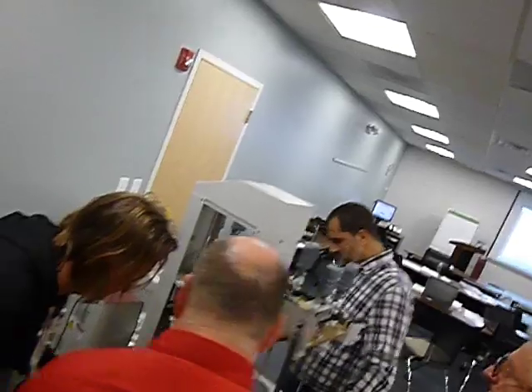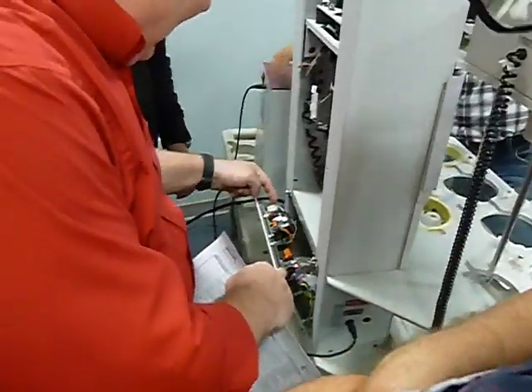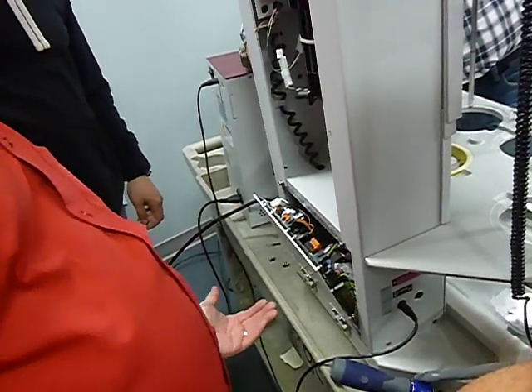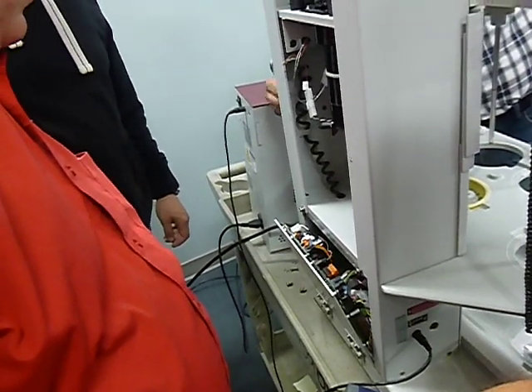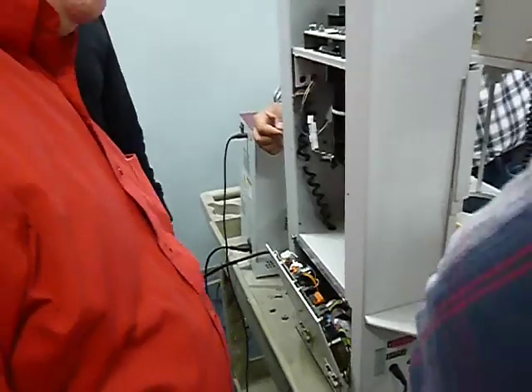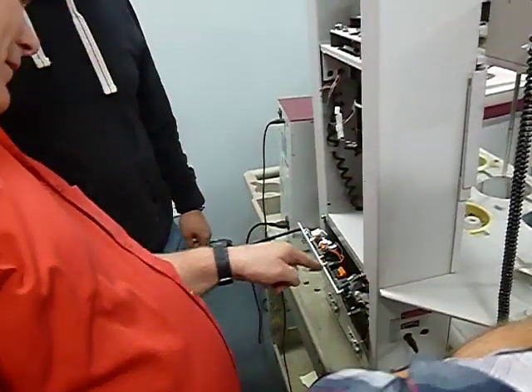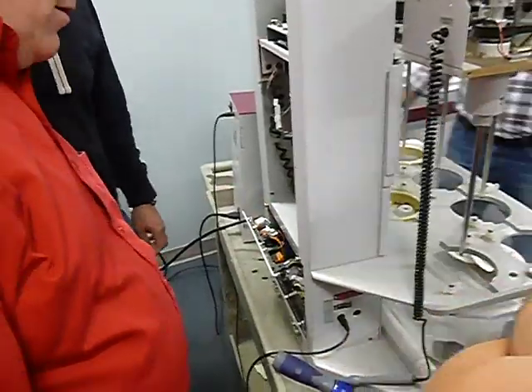You could just open it up. Yeah, actually, I got it. It's open. You turn power off. You just take these 2 connectors, this one and that one, and you could fold it all the way down so you can get access inside. You don't have to remove this. You just have to have it to where it'll actually fold all the way down. And we can access it from here? No. On this side? From the back. You have to access it from the bottom, you have to get to it inside. From the right, back bottom, there. Yes. Actually, I'll just show you. We just turn it off and I'll show you real quick.